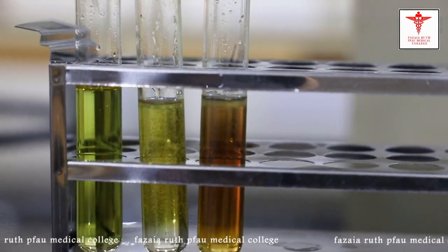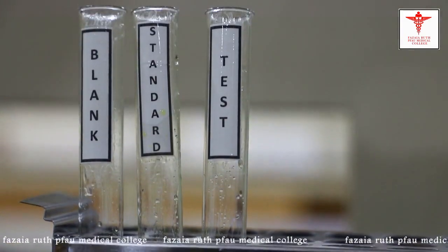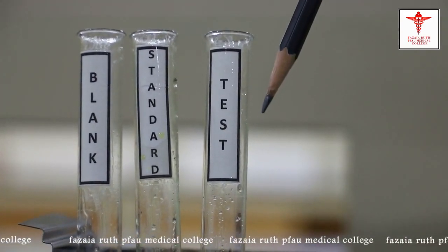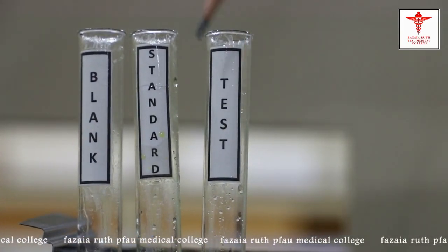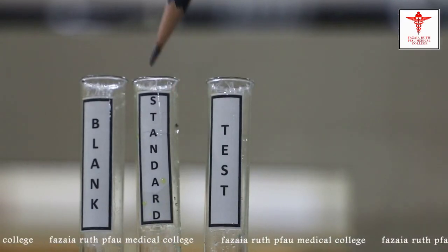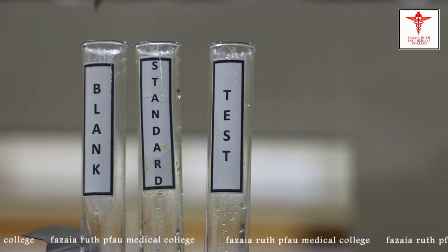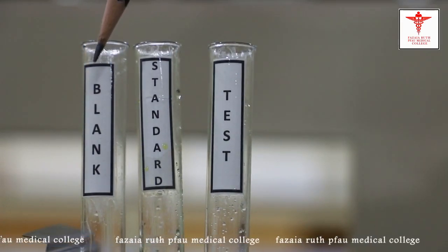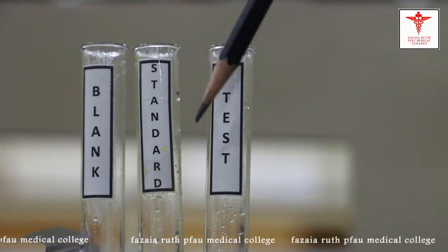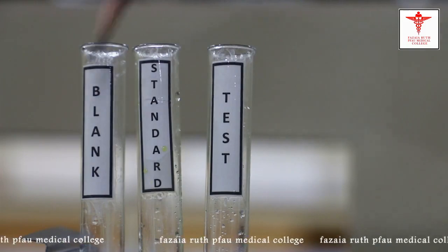So this is how we add the reagents. The test tube contains 0.1 ml of the sample whose concentration we need to determine, along with ferric chloride and 4 ml of sulfuric acid. The standard contains 0.1 ml of a known concentration of cholesterol solution, ferric chloride, and sulfuric acid. The blank only contains the reagents — ferric chloride and sulfuric acid. We'll leave these test tubes for around 20 minutes and then take the transmittance of each.